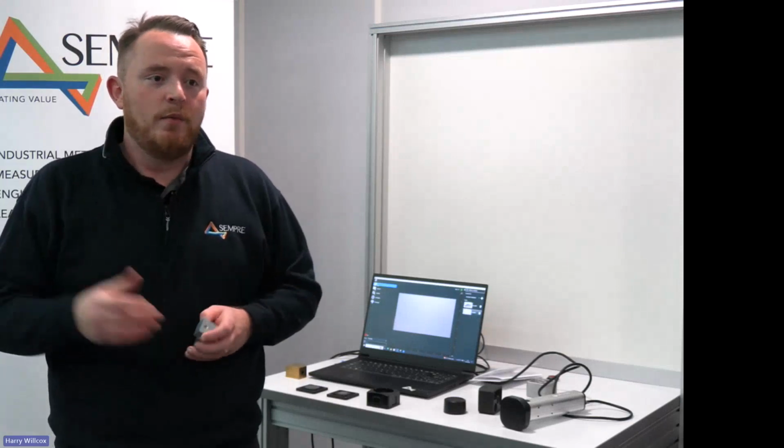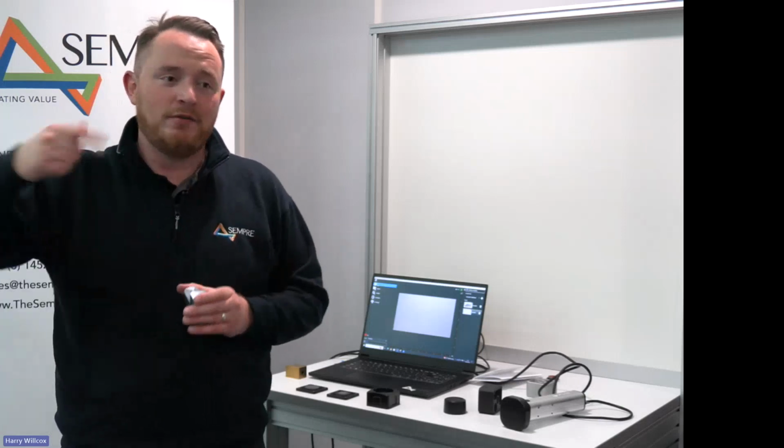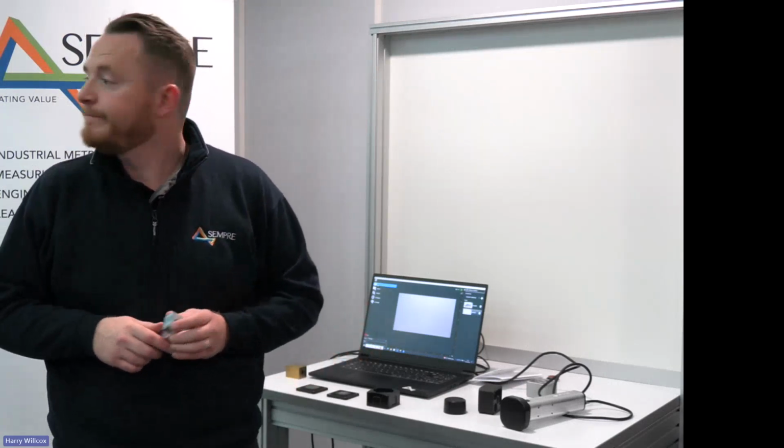And with a lot of our clients that currently use the system, we run a quarterly catch up. We just jump on a Teams call for half an hour to make sure that everyone's happy and using the systems, because we tend to find that when people acquire a Gelsight, it just rolls on to them using the system more and more, because they save so much time compared to other, traditional methods, we should say.